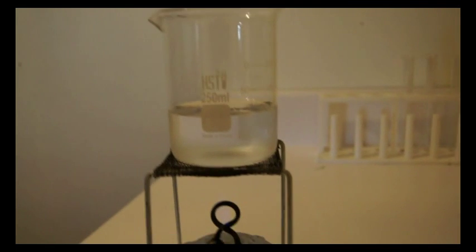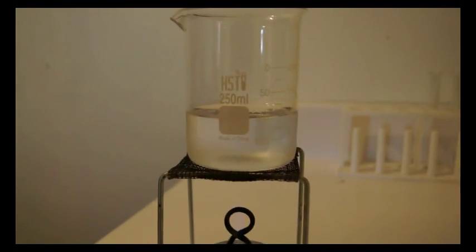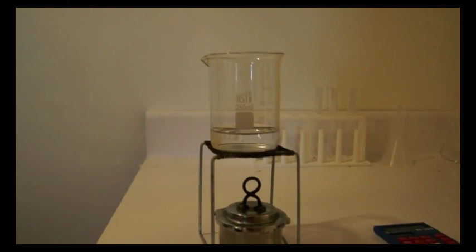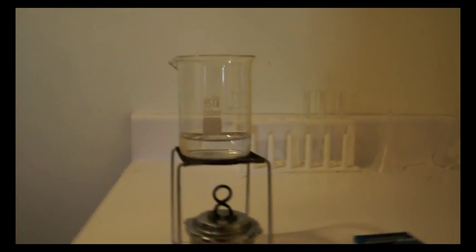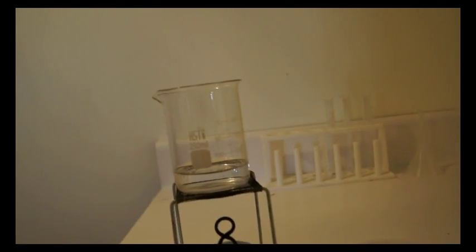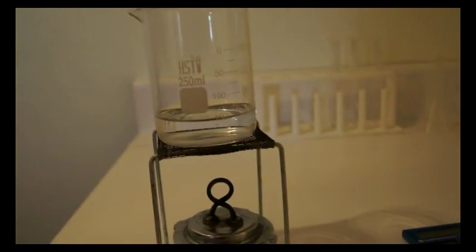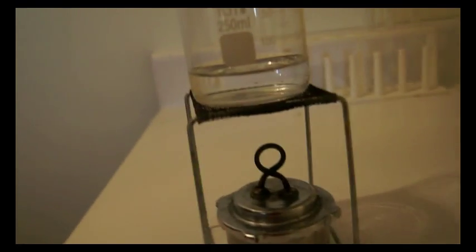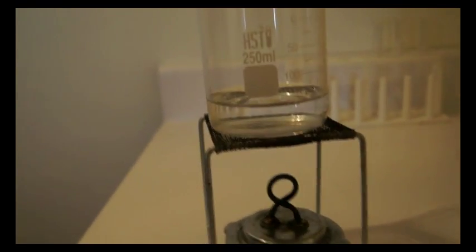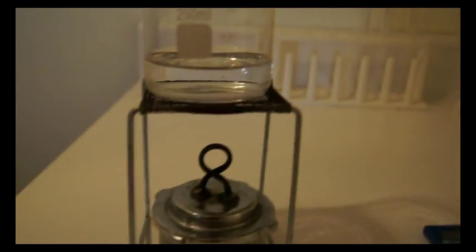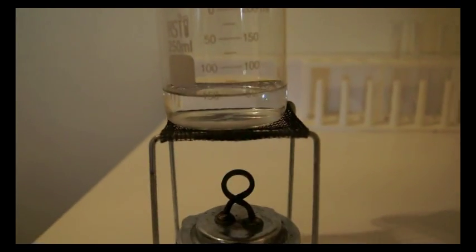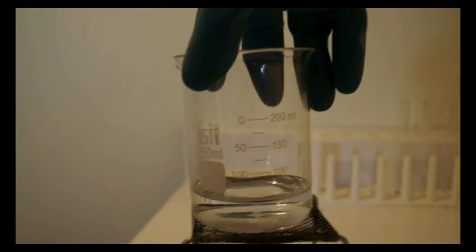Now it's been about 30 minutes to an hour, and it's done. It is now down to 50 milliliters and I've been letting it sit here for a few minutes just to get all cooled down. So we're going to do the math now to find out what concentration it is.